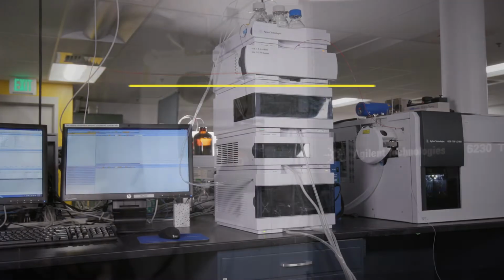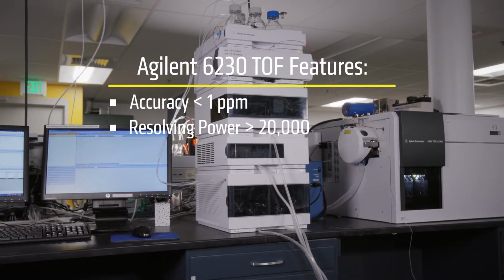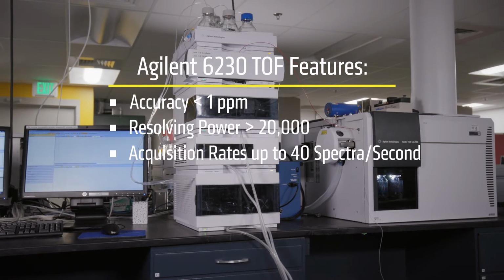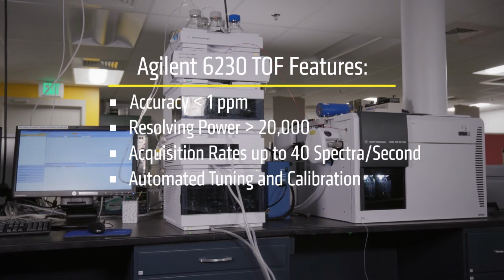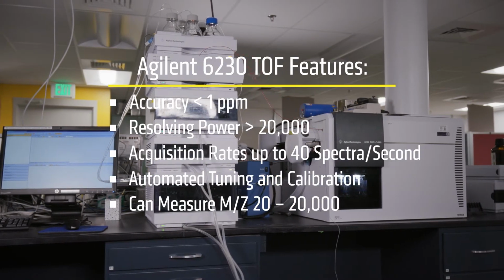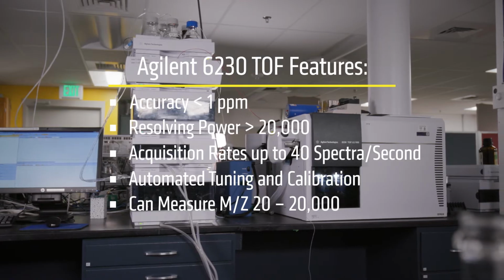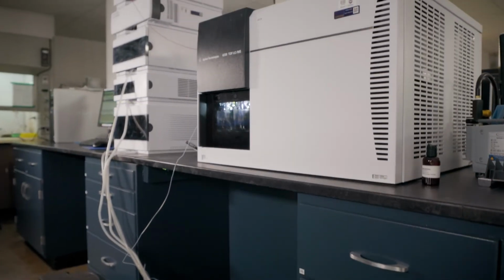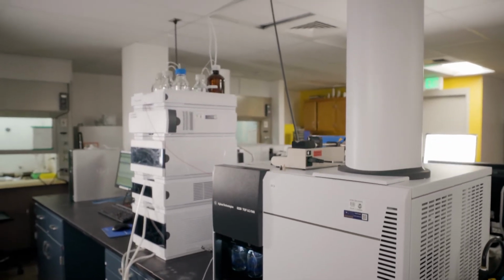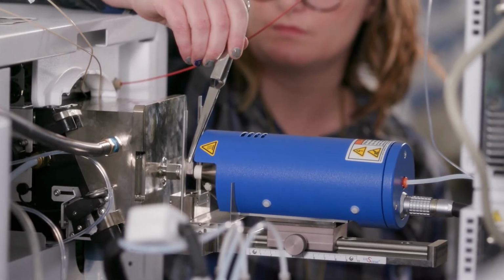These are mass accuracy at less than 1 part per million, resolving power greater than 20,000, acquisition rates up to 40 spectra per second, automated tuning and calibration, and finally, this instrument can measure molecules with mass-to-charge ratios between 20 and 20,000, which makes this instrument suitable for measuring small molecules like organic natural products and pesticides, all the way up to large macromolecules like multiply charged intact proteins.